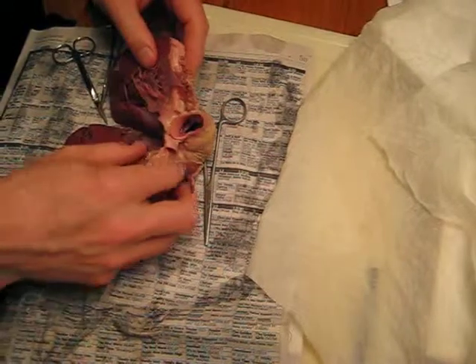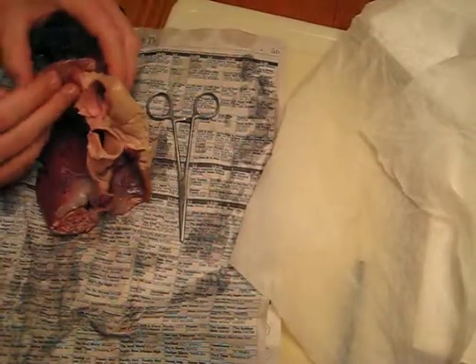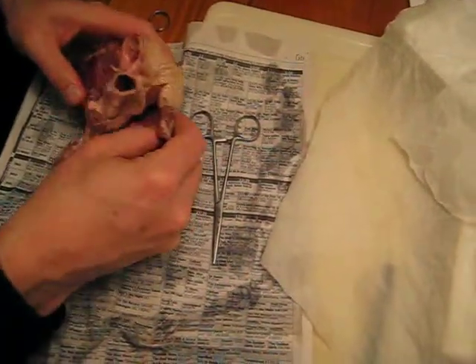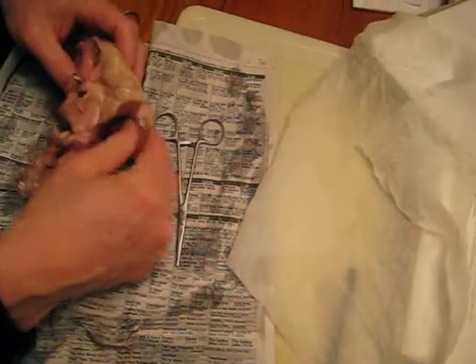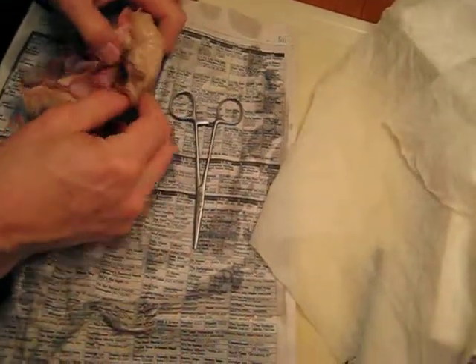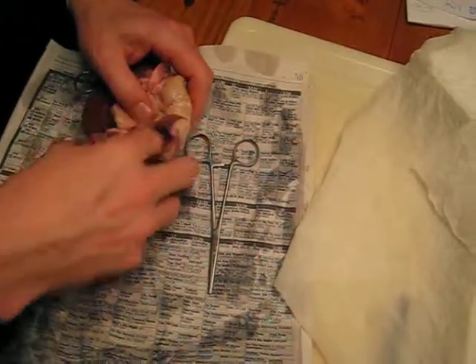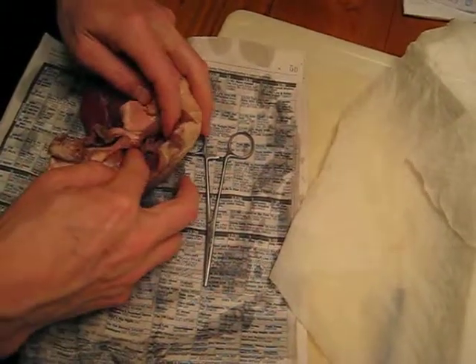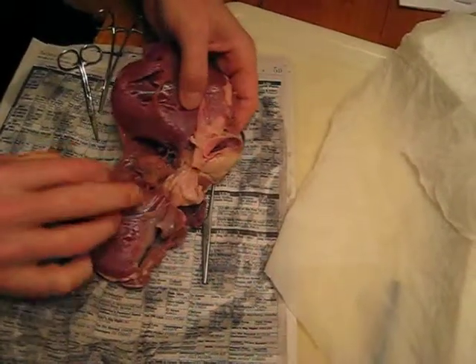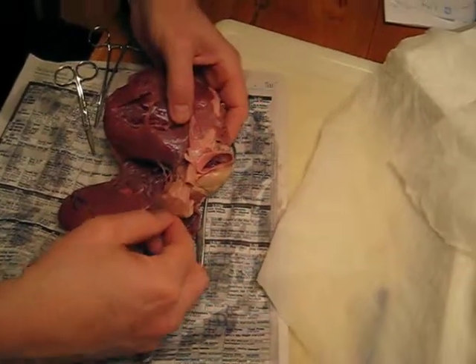So then you go to the other side of the heart and you say, okay, well, how does blood get into the heart? Let's go over here. And what you see is you've got this great big chamber over here — that's your right atrium. Blood goes in through a valve, and your valve is right here. You can see all the chordae tendineae on the valve. It goes in through that valve into this little thin-walled chamber that's been kind of ripped up a little bit. This is probably part of the wall that got torn away.